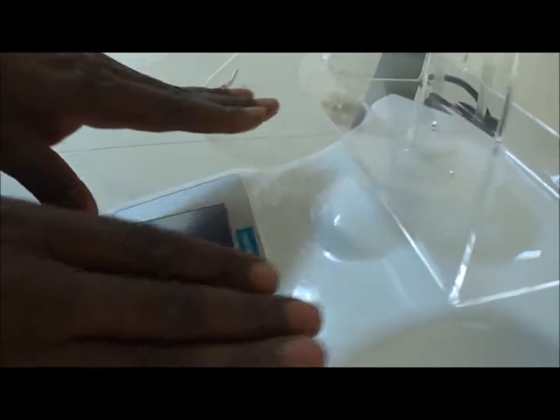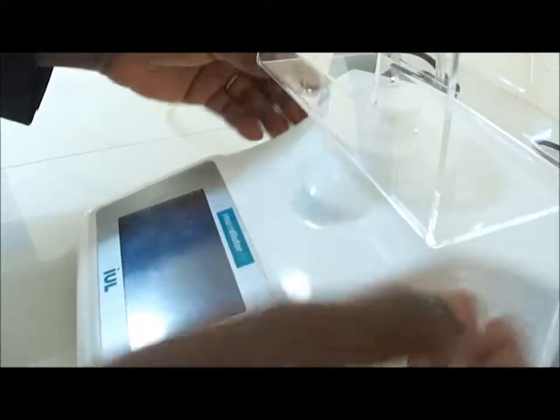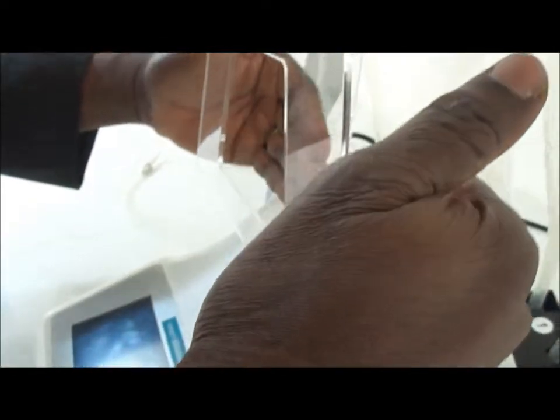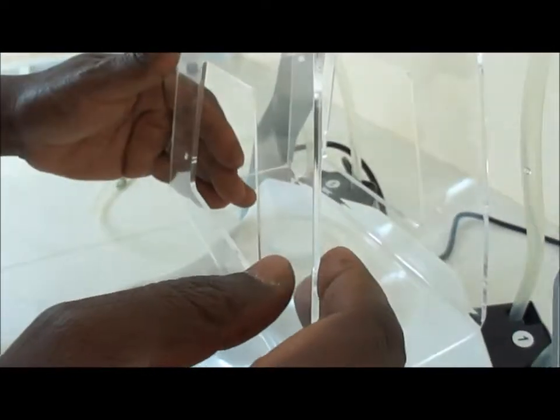One should remember that here actually is a scale. There is an electronic scale here. All things you will put here will be weighed, and there is a way to tare the system also. So if you put the plastic bag inside, the weight of the empty plastic bag will be tared first and then the system will put zero.